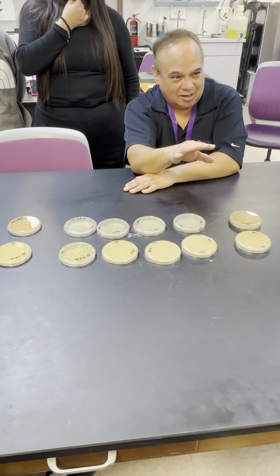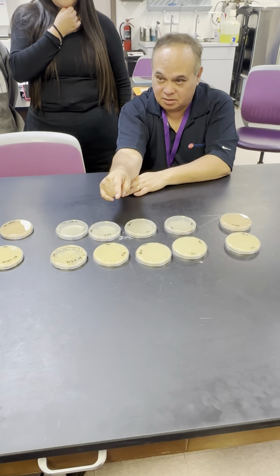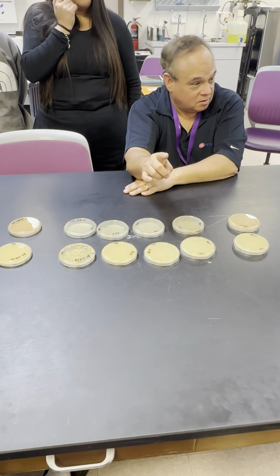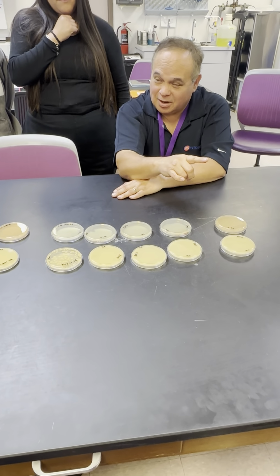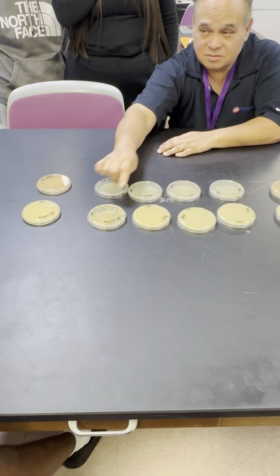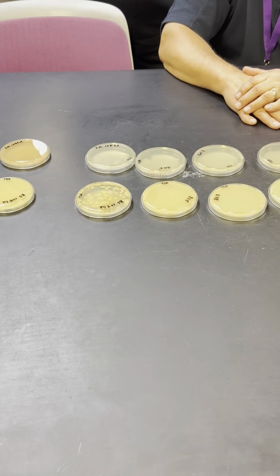So can you see that bacteria is smart. UV cannot be used as a sterilization method because it doesn't kill the endospore. And by definition, well, that's sanitizing also, right? But at 10 minutes, it's pretty good, right? But still, look at all the organisms. That's why when Clostridium or Clostridioides difficile gets in an environment, it's hard to get rid of.